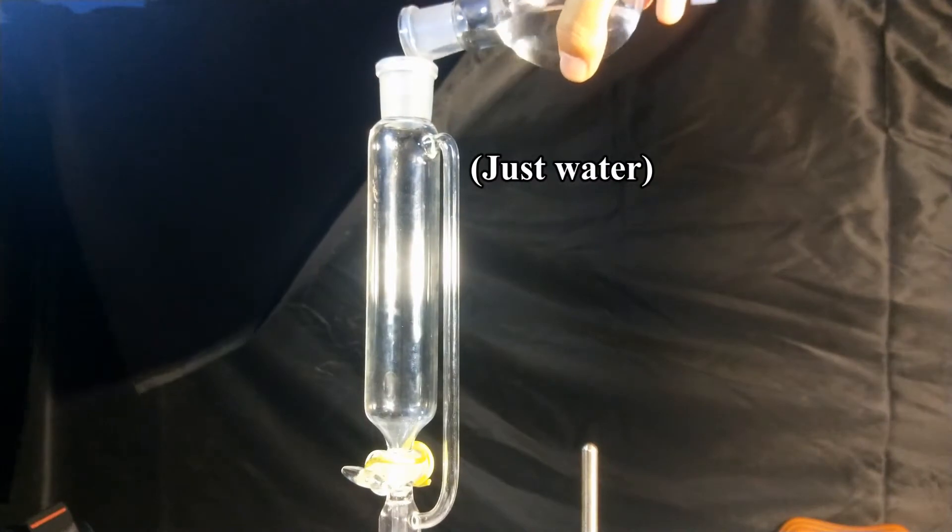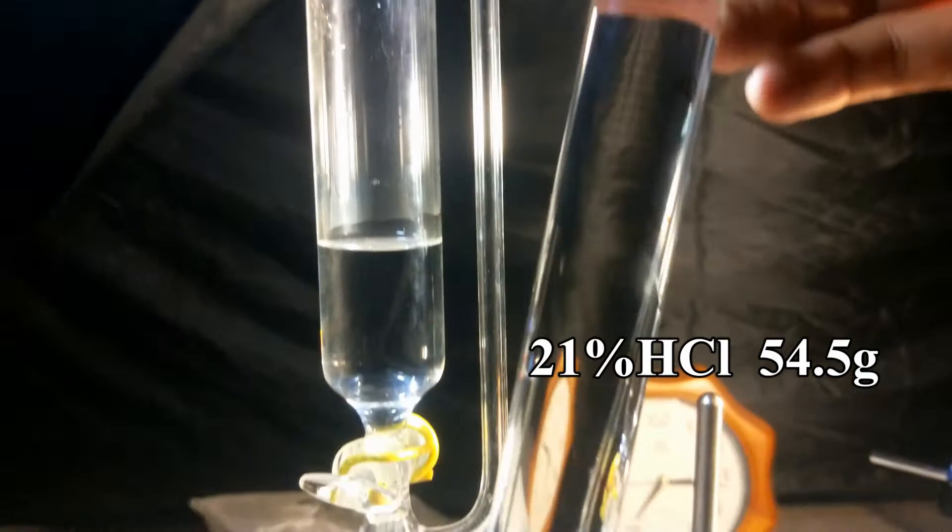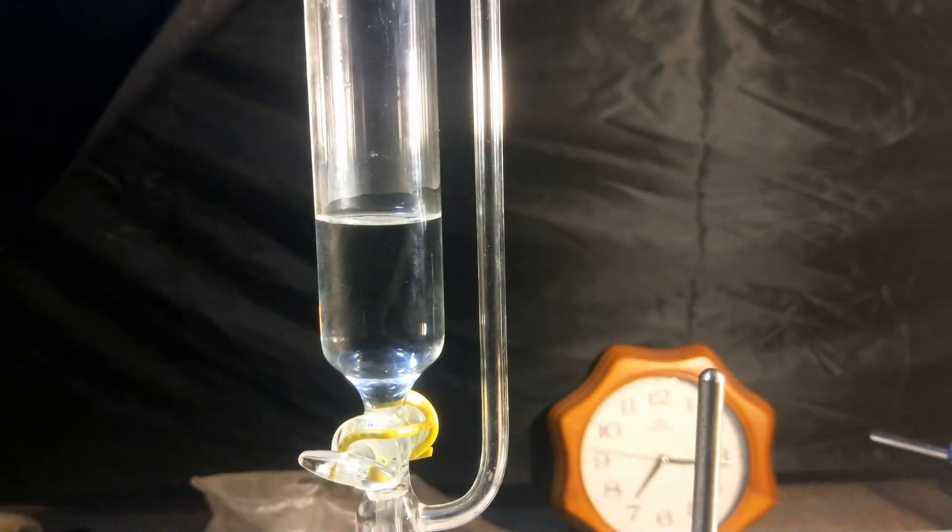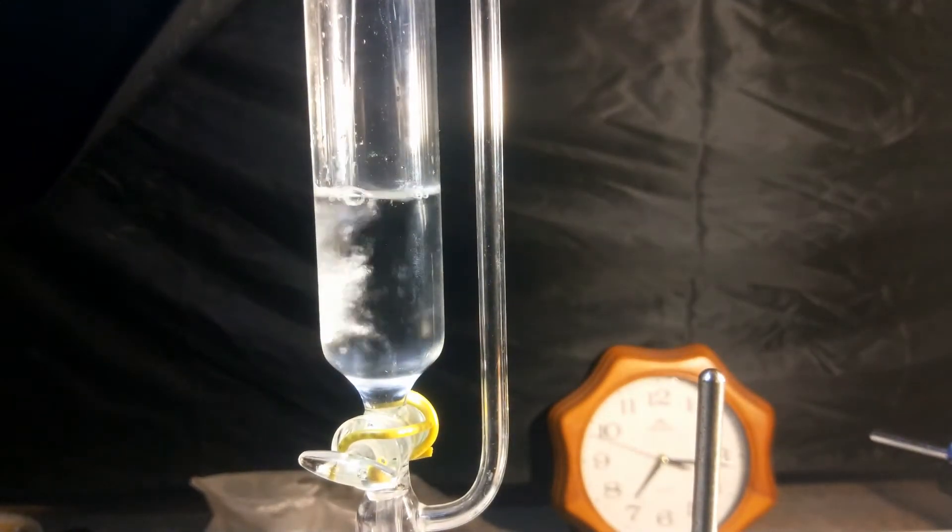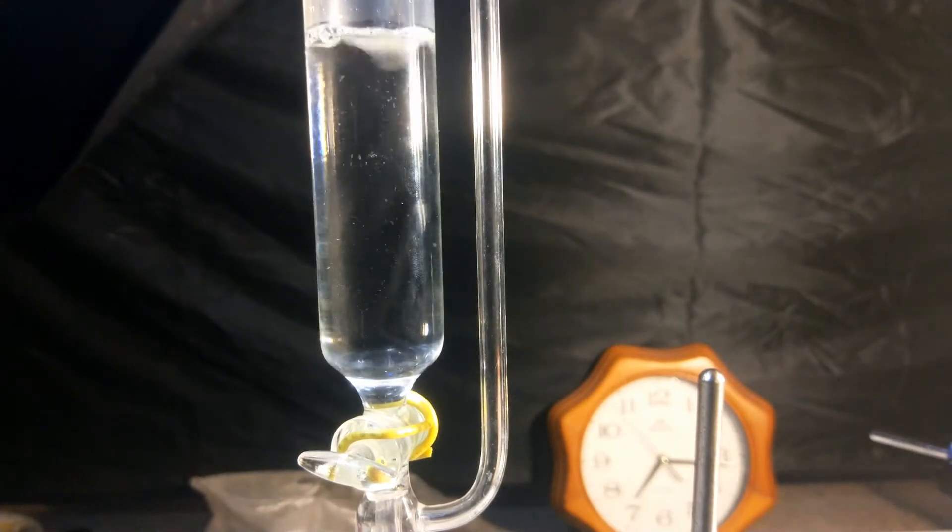Arbitrary amount of water was added to the funnel. Then 54.5 grams of 21% hydrochloric acid was added. The purpose of diluting the hydrochloric acid was to achieve better control of chlorine generation, and the magnetic stirring will also help.